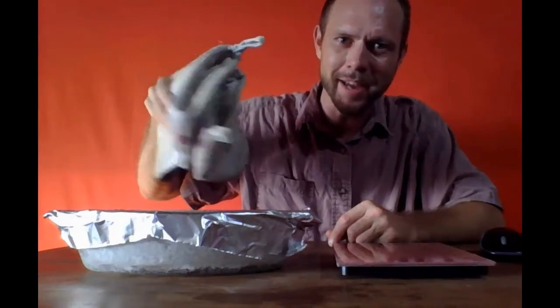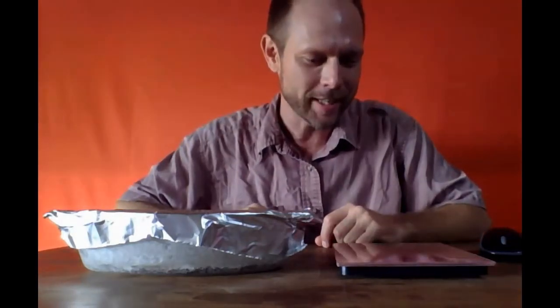And you see I just touched it. You see I've got my oven mitts here now. These are actually not going to be used, right? You don't want to handle this thing while it's hot. It obviously was very hot. I did use the oven mitts to take it out of the oven, and then I'm just going to let it air cool for maybe an hour or so until it's completely cool to the touch. And you notice that I haven't disturbed anything.